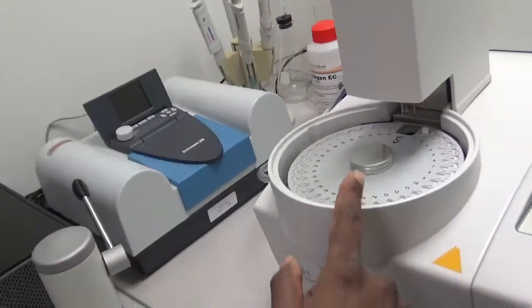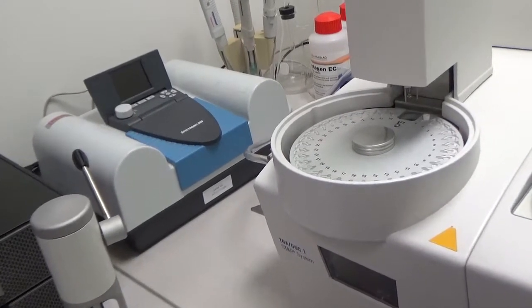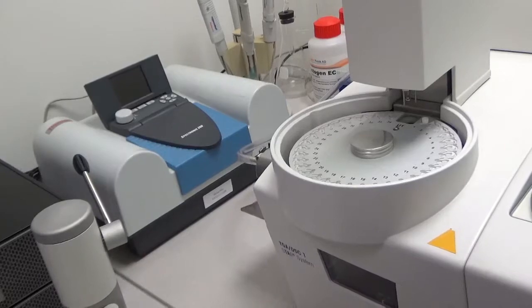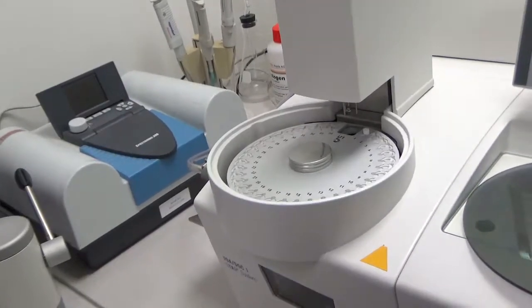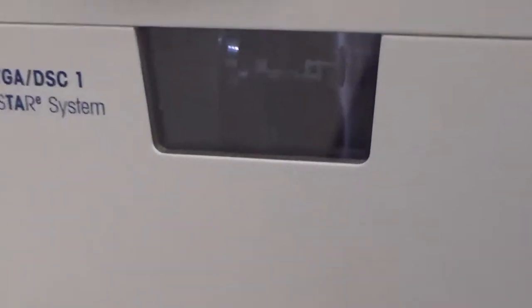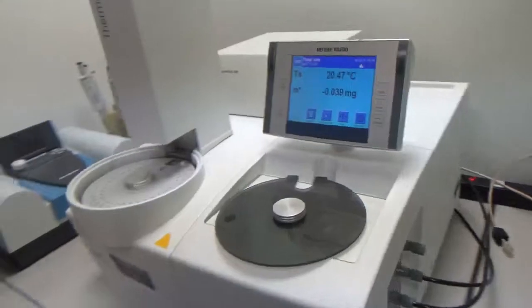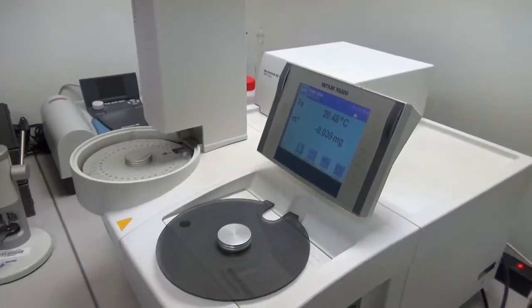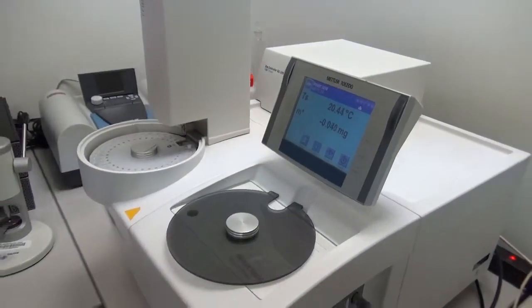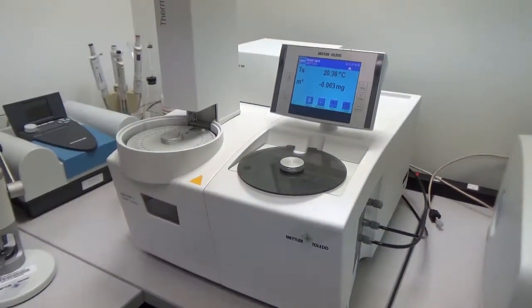The three rods of the robot go down to make sure there is no sample sitting there. You can see inside when the robot goes in and tries to see if there is any sample or not. It sees there is no sample. The furnace closes — it's a pretty smart system — and it's ready for the first sample loading.